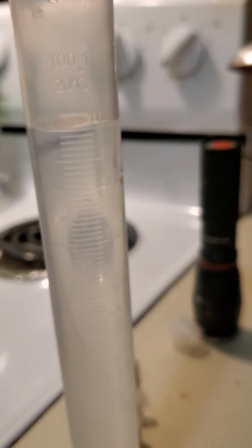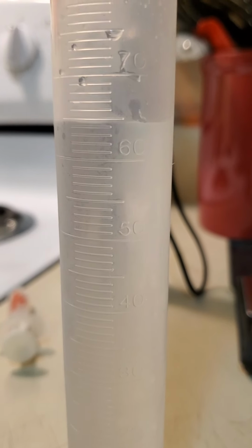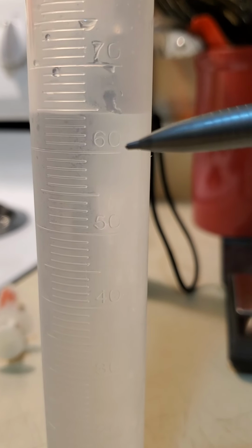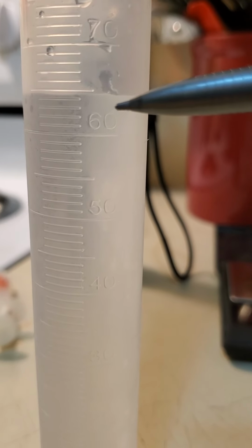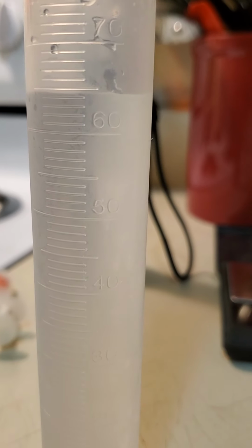And next I'm going to carefully measure exactly how much water is in the cup. Okay, so there's the first 100. I've still got a little bit to go, so I'm just going to dump this out and pour in the rest and measure that. Okay, so we had the full 100 milliliters, and then we also have up to 64.5, so 164.5 milliliters of total water after the ice cubes have melted.